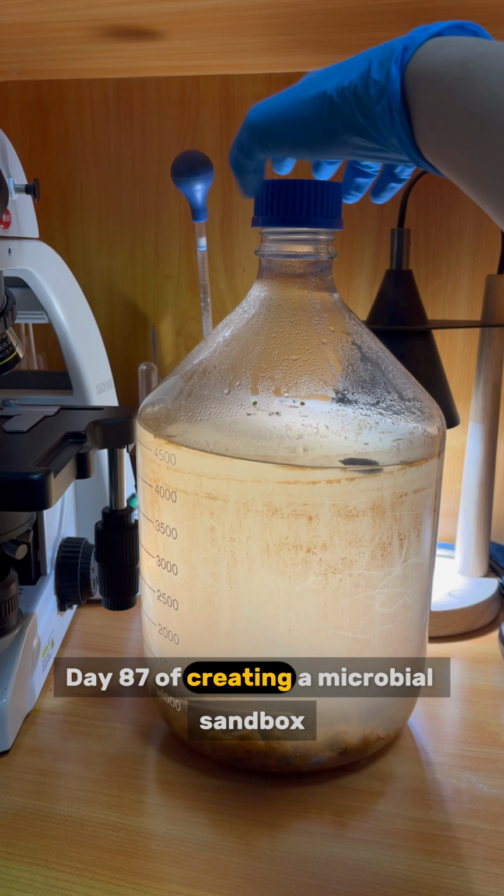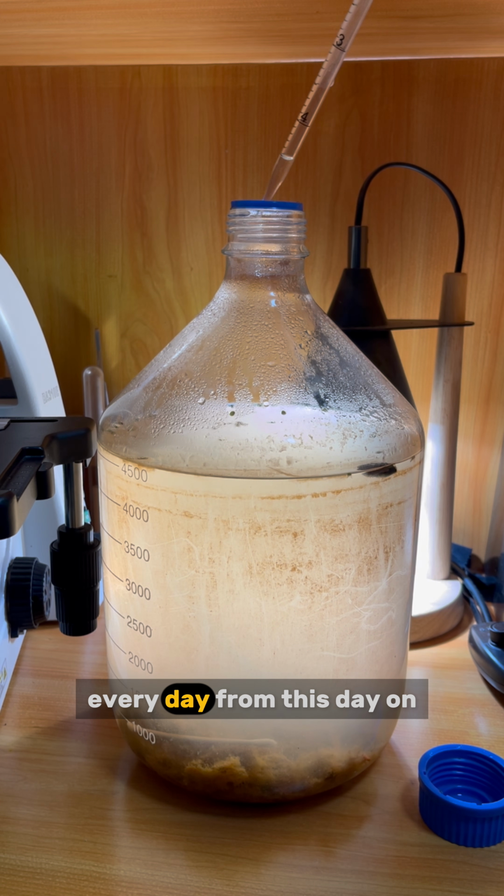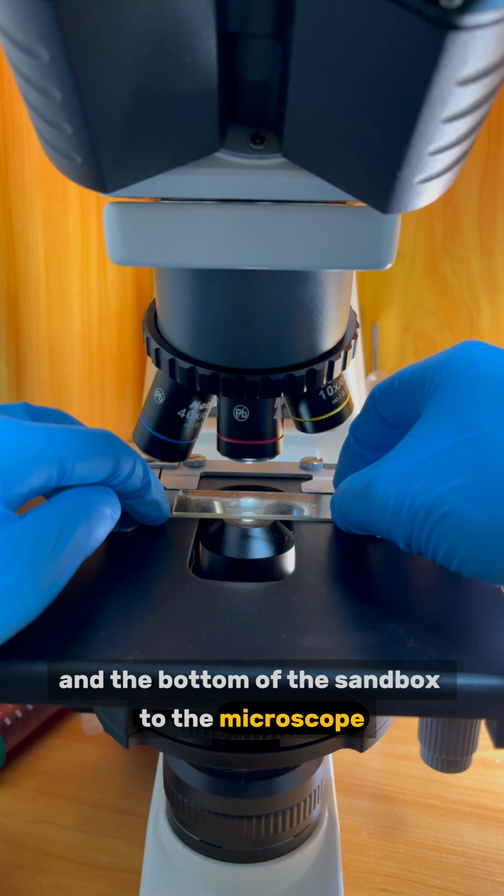Day 87 of creating a microbial sandbox by adding random stuff and observing it under the microscope every day. From this day on, I will take both the surface and the bottom of the sandbox to the microscope.